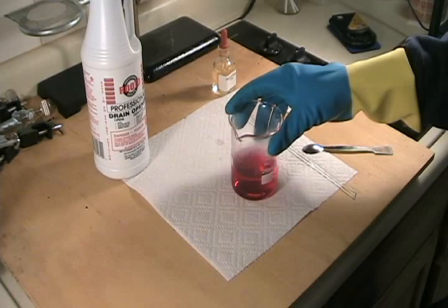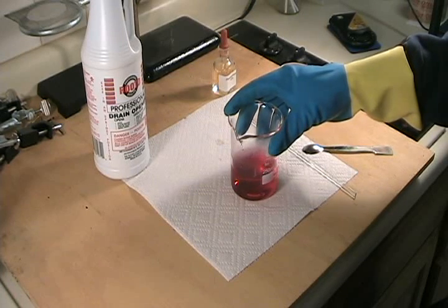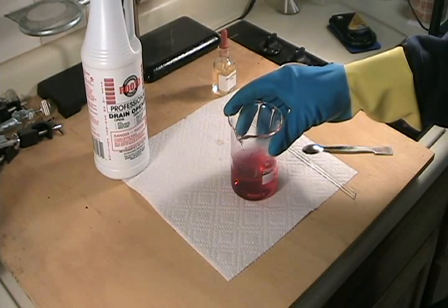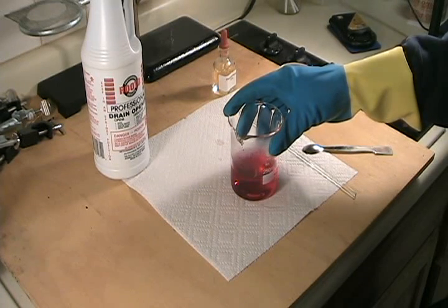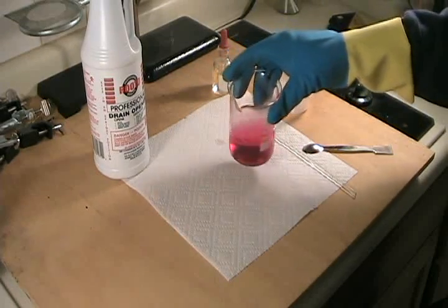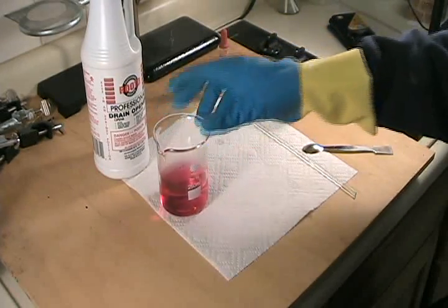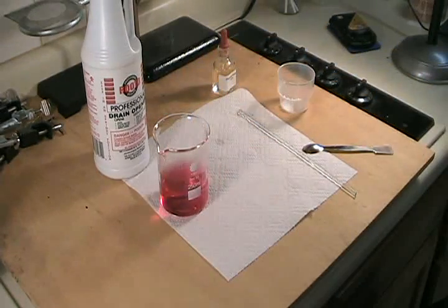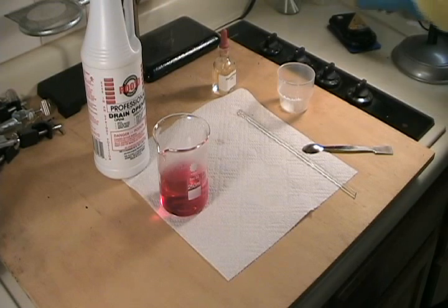The contents of the beaker at this point are a tiny amount of phenolphthalein, water, sodium sulfate, and whatever dissolved solids were present in our original aliquot of acid. Let's set the beaker aside for a moment.